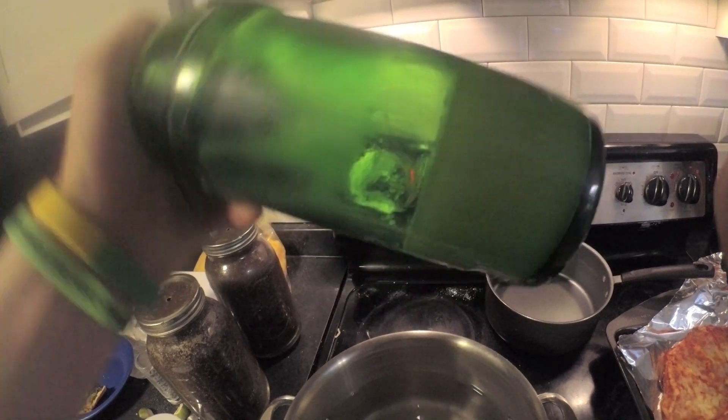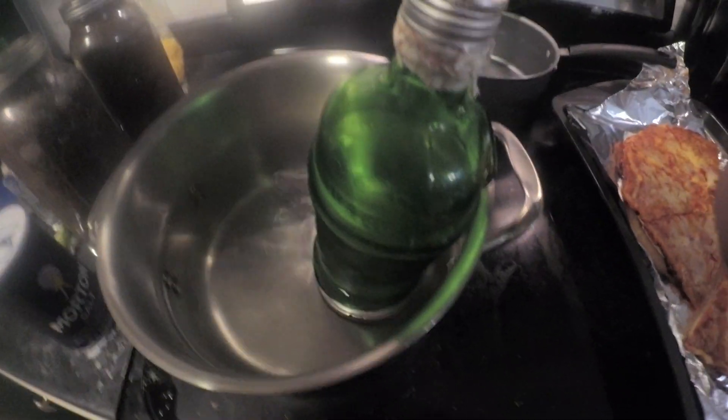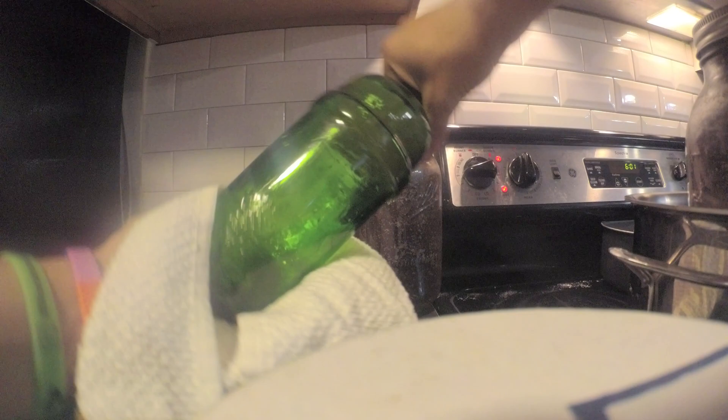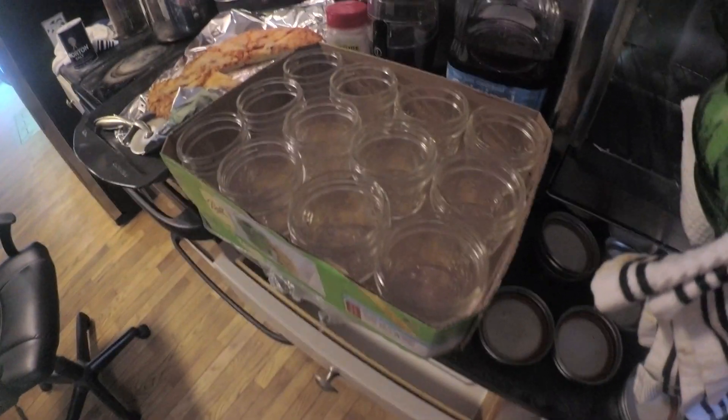Here it's starting to melt down. You want to make sure that it's on something so it doesn't hit the flames directly. I use this jar of substrate to hold it down — you can see it's starting to melt. If it starts to bubble at the top and you want to store it, you want to replace that filter.